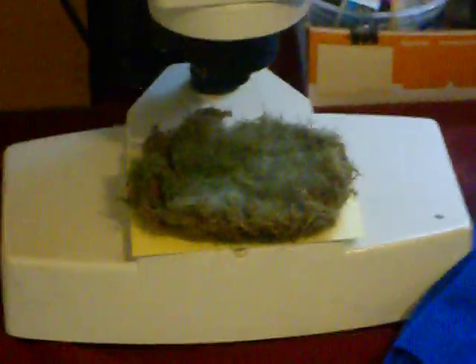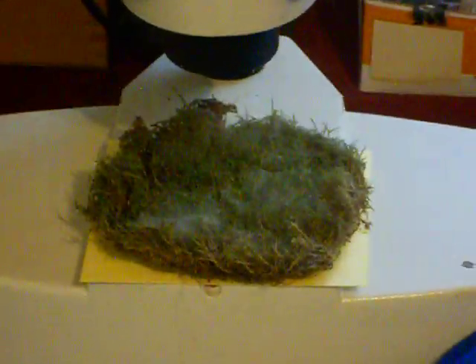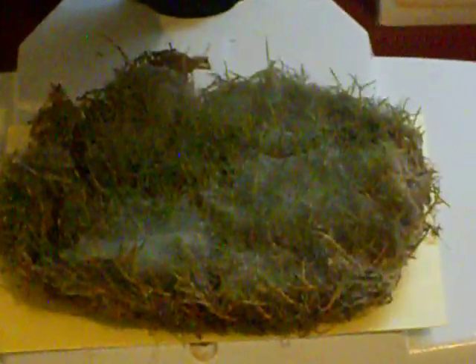Now, down below, that's a sample, and I've selected one that has some obvious disease on it. That happens to be Pythium, but I would begin my process by plucking out some small samples of leaf tissue and mycelium tissue to be able to look at that and later diagnose it.